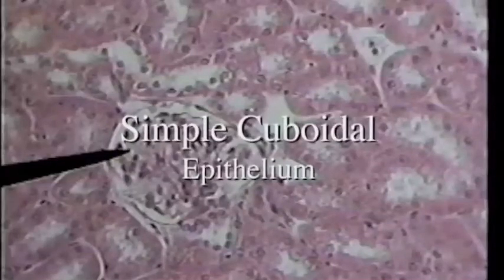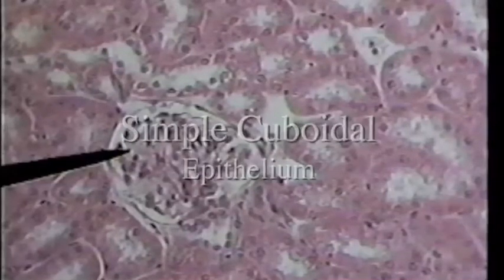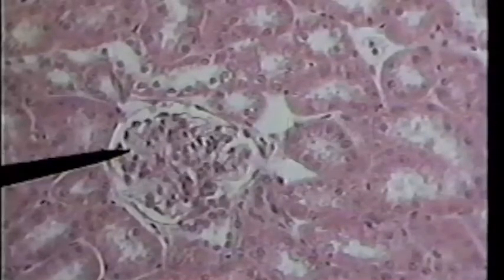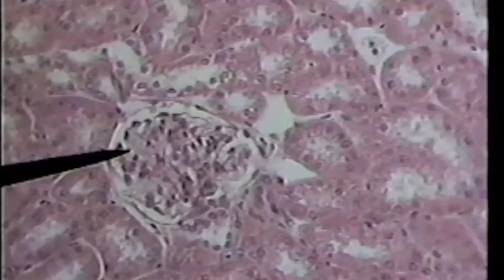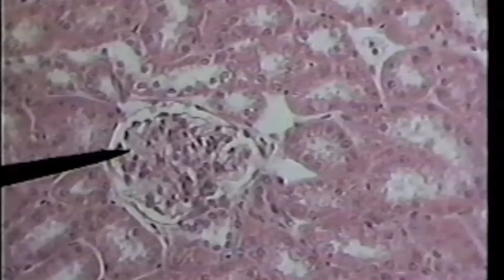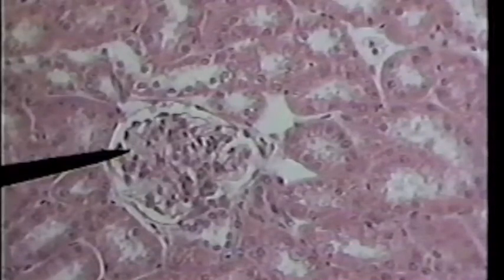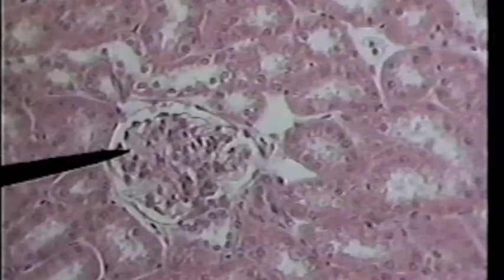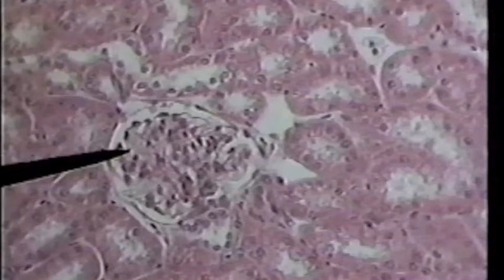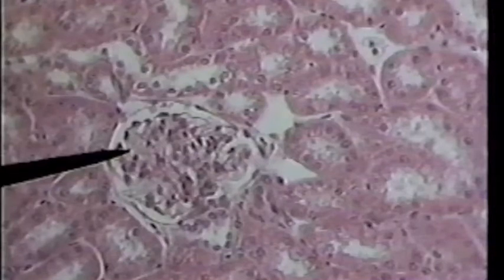We are back now looking at the kidney slide on high power. The pointer is pointing at the structure we were looking at before. This structure is known as the glomerulus of the kidney, and we don't need to worry about the fact that it's the glomerulus until we get into Bio 202.